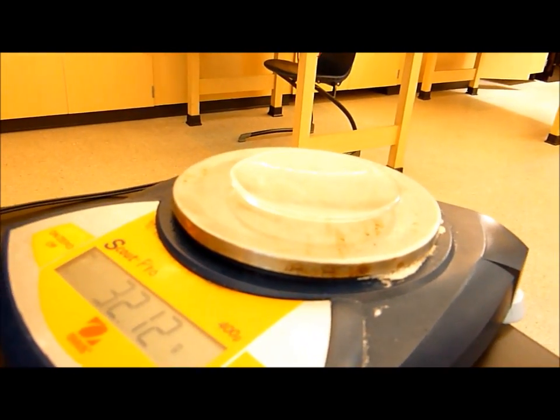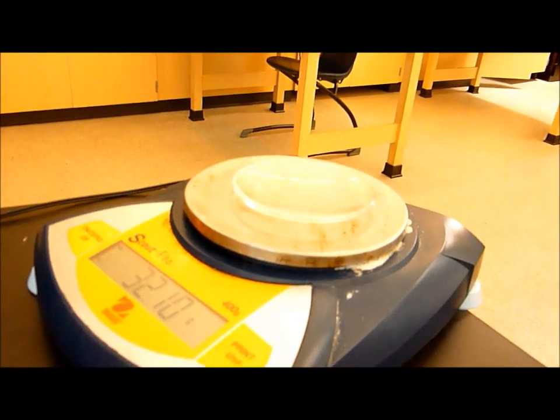Record the mass of a clean, dry watch glass. Transfer the copper to the watch glass. And make sure that you have scraped all the copper onto the watch glass.